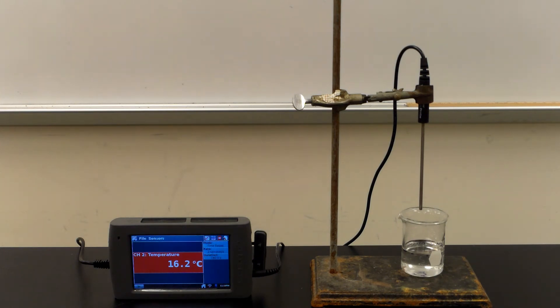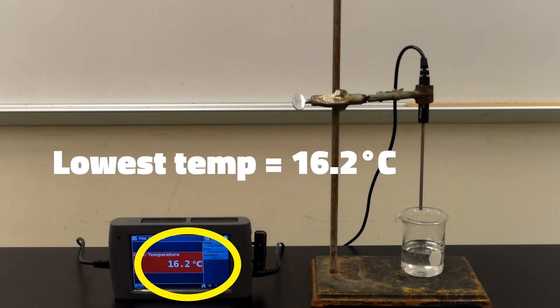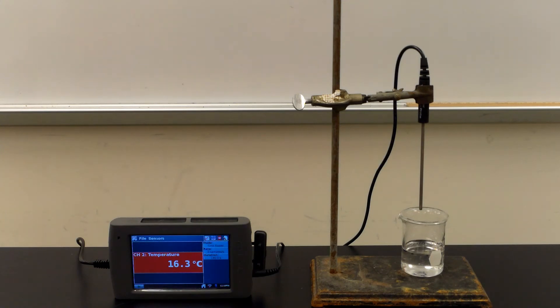We'll continue to watch this just to see the lowest temperature that the probe reaches. It's actually looking like it's starting to go back up now, 16.3. And now it's continuing to move up to 16.4. So we would expect that this will continue to warm up.